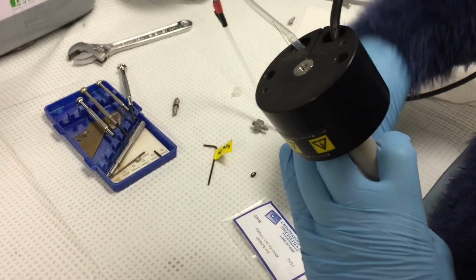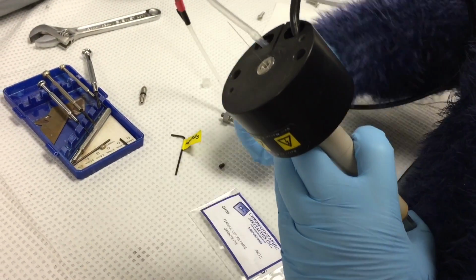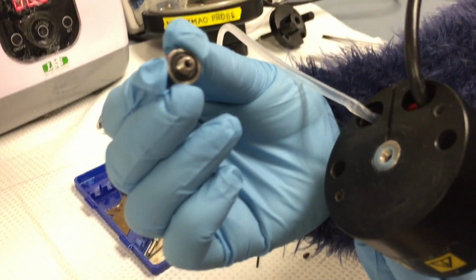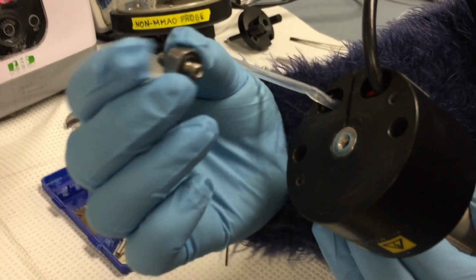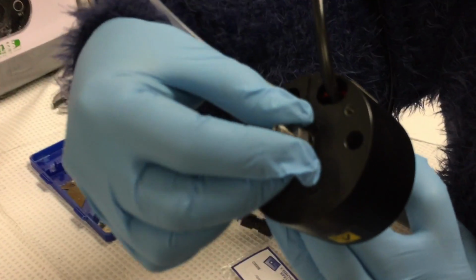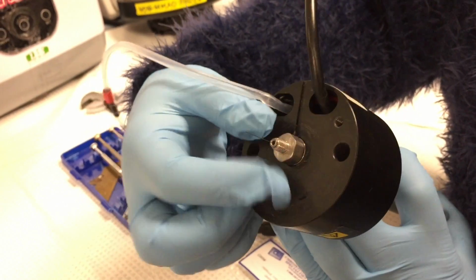So next, I put this nut on. You can see there's an O-ring that allows for close contact between the two metal surfaces. So we just put the nut on and screw it on.